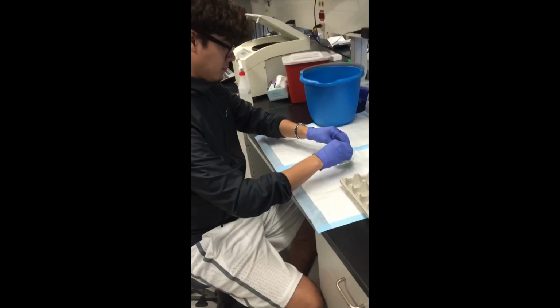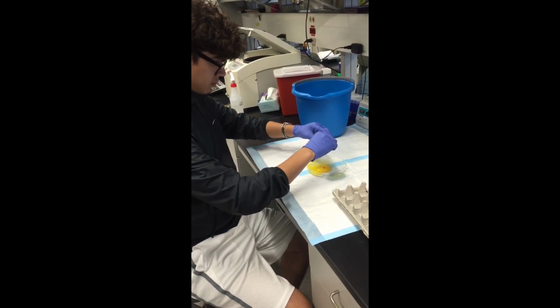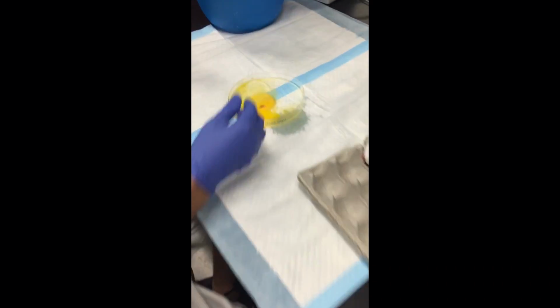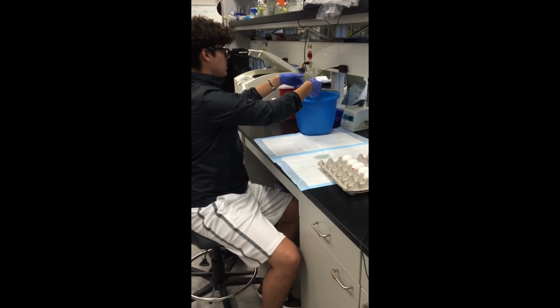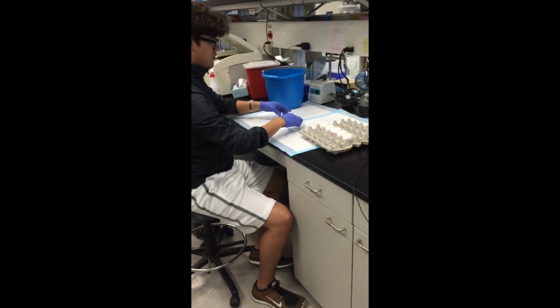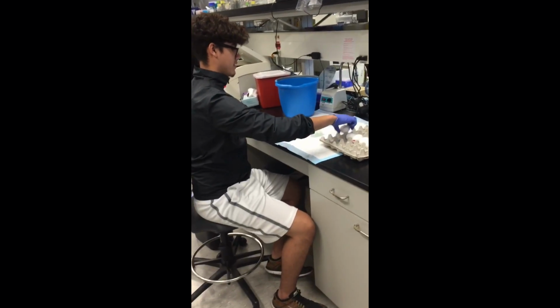And for this specific experiment, we're doing an egg in a cup, where we do an ultrasound of the heart. To begin with the egg in a cup experiment, fertilized eggs should be incubated for 48 hours to stage 13. Cracking of the egg is necessary in order to see if the egg is correctly developed or late. Some of the eggs are not fully developed, others are blank. For that reason, several eggs are required to crack and stage during this step.